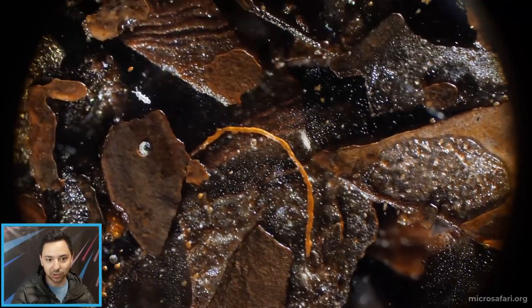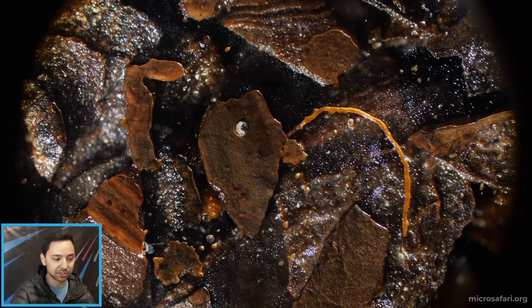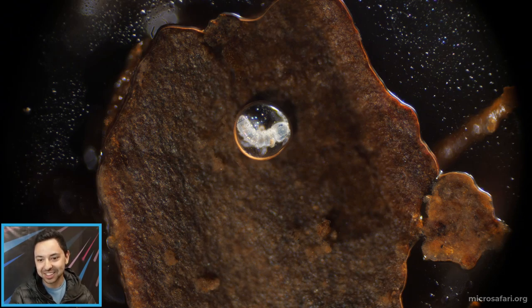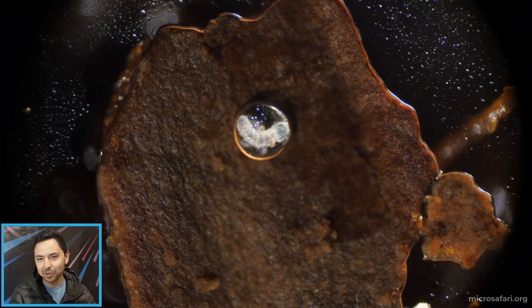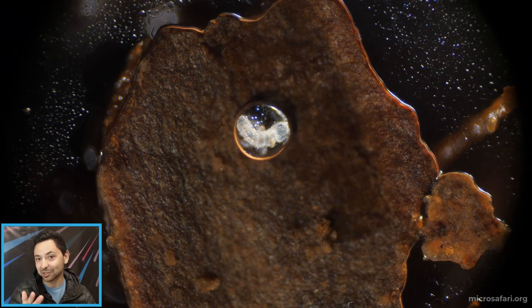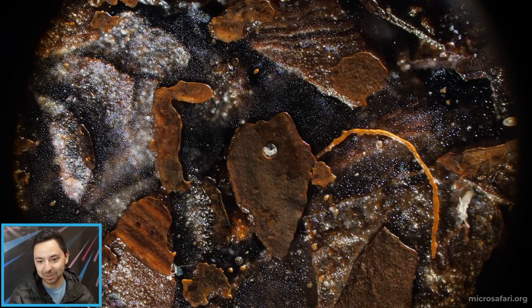Here we've got some springtails running around. Oh, it looks like we actually found a springtail that itself is trapped in a droplet of water. Oh, poor thing — it's a little baby springtail trapped in this little droplet of water. I'm assuming it'll be fine; this water will evaporate hopefully soon. The water dynamics in here have changed quite a bit, so fingers crossed it'll be able to get out at some point.